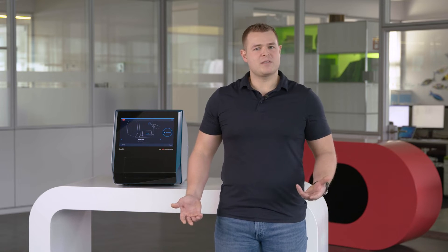These benefits make the Monolith X a great tool for your lab because it has approachable sample handling and the data analysis is very straightforward. It also gives you the ability to tackle a diverse range of different targets as well as ligands. My name is Nathan Wallace. I am an application scientist here at Nanotemper, and in my role, I have empowered many researchers, just like yourself, who are not only trying to find a tool to measure binding affinities, but also need to make educated decisions much faster. I love to teach people about the Monolith X, how to use it, and why it is such a versatile tool for their labs.